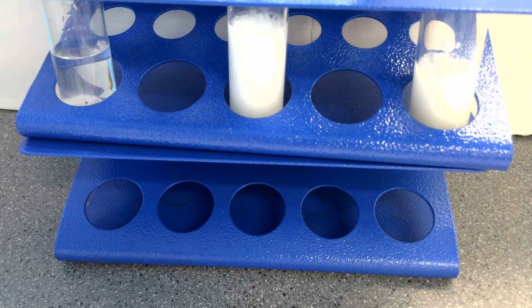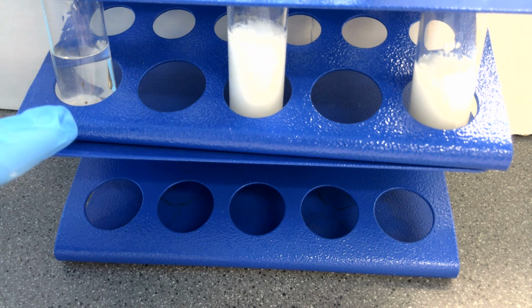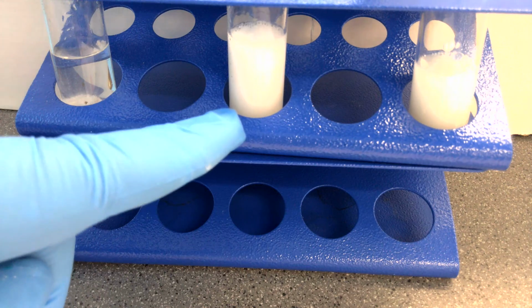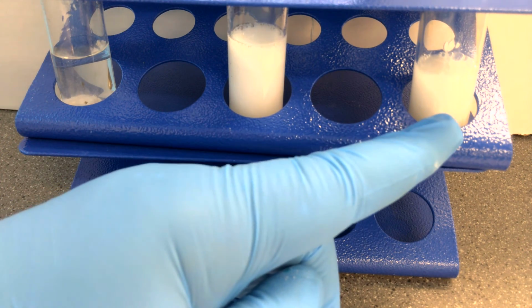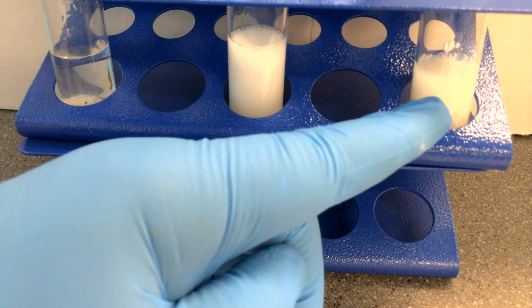When the reaction is finished, the evidence of this would be we would observe no bubbles being formed any longer. If you see here, you can now see more clearly bubbles of carbon dioxide being produced from the calcium carbonate chunk. You can still see carbon dioxide gas being produced with calcium carbonate chips or pieces, and you can still see carbon dioxide gas being produced with bubbles in the reaction between the acid and the calcium carbonate powder.